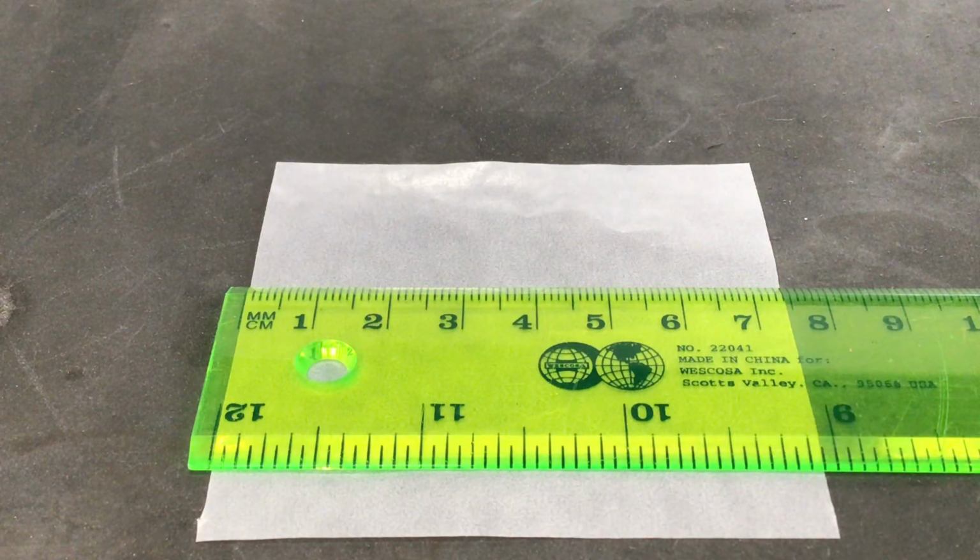All right, so first up, as far as looking at our tools for measurements, we're going to just look at simple rulers, measuring lengths, and point out a few things when it comes to the metric system versus, say, measuring things in inches. That'll allow us to apply sig figs in a way I think makes sense for using the metric system, which is what we tend to gravitate towards in most science labs.